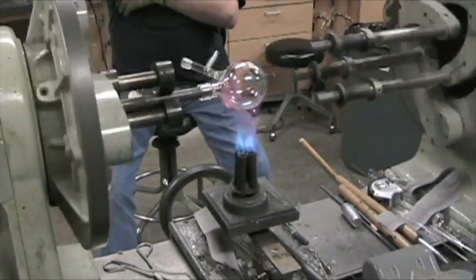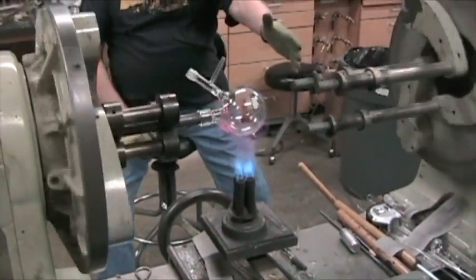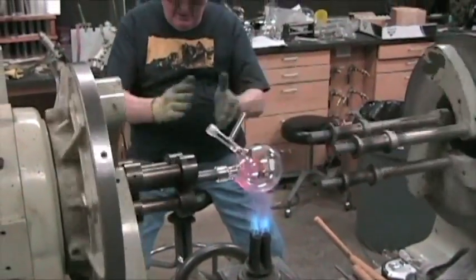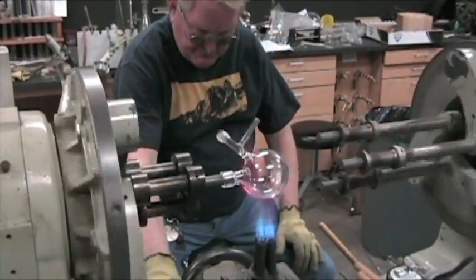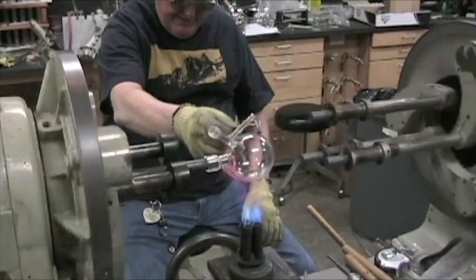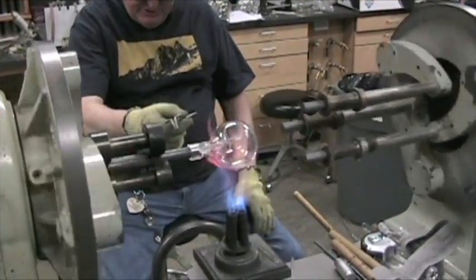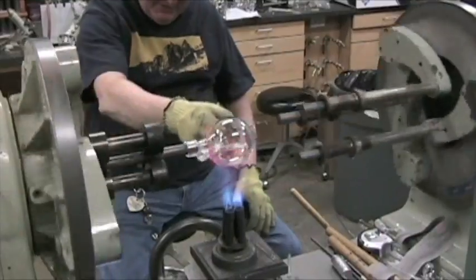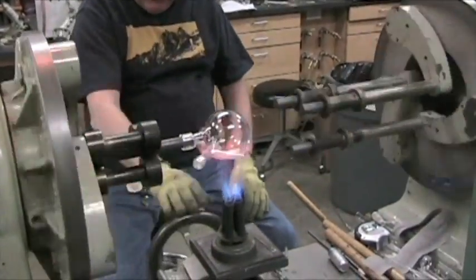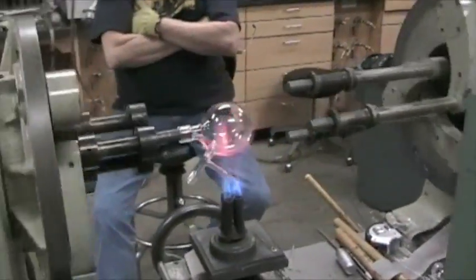See how there's a lot of orange on this side over here, and very little orange on this. And a little bit, it'll all equalize. Right now, there's a stress band that's traveling through the glass. I'm running about this area here. This side is not projecting any orange sodium out. It is on this side. This side's warming up. This side is not quite yet. But watch the flame as it grows, equalizes the whole piece.